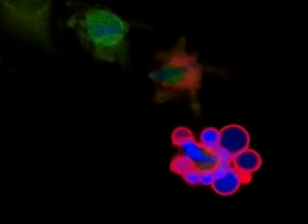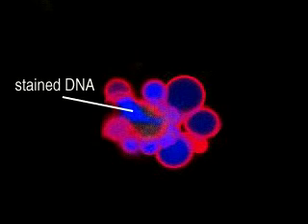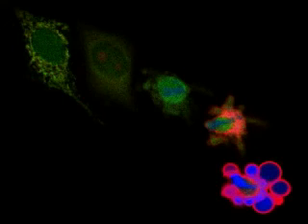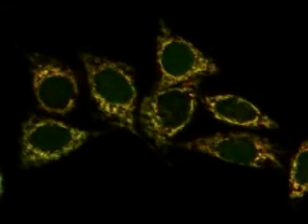Finally, although apoptosing cells don't lyse, their plasma membranes do become permeable to small molecules. This event has been visualized here by adding a dye to the media that fluoresces blue when it can enter cells and bind to DNA. All three of these events can be observed simultaneously.